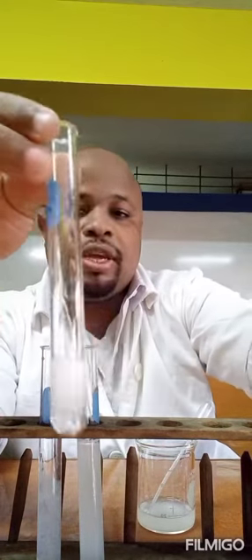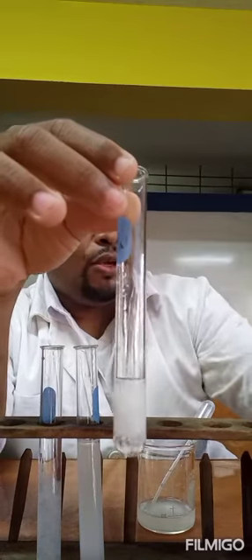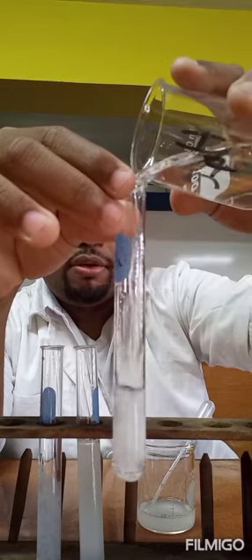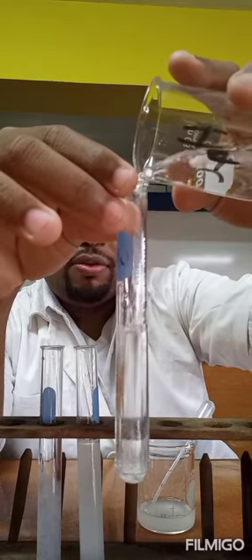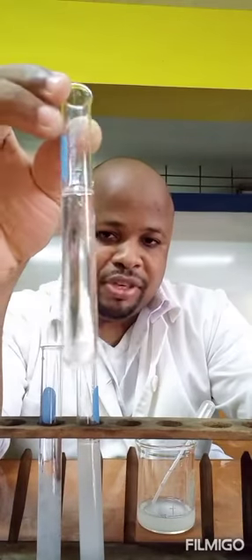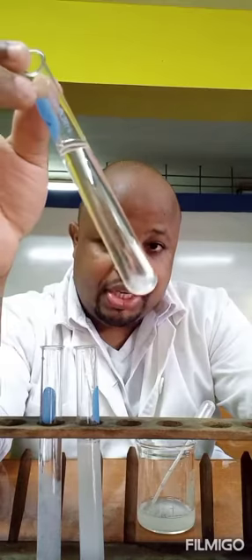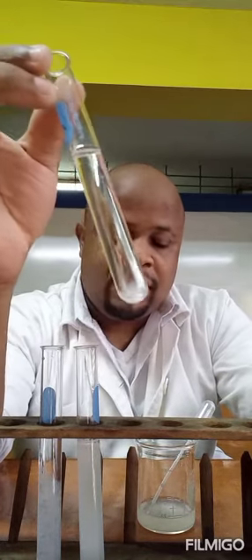We are going to add aqueous ammonia and watch what happens to the precipitate. We see that the precipitate dissolves in aqueous ammonia. So: we add nitric acid, then silver nitrate, get the white precipitate, and it dissolves in aqueous ammonia. You should know which negative ion does that. After this you can confirm which ion is present and the name of the salt.